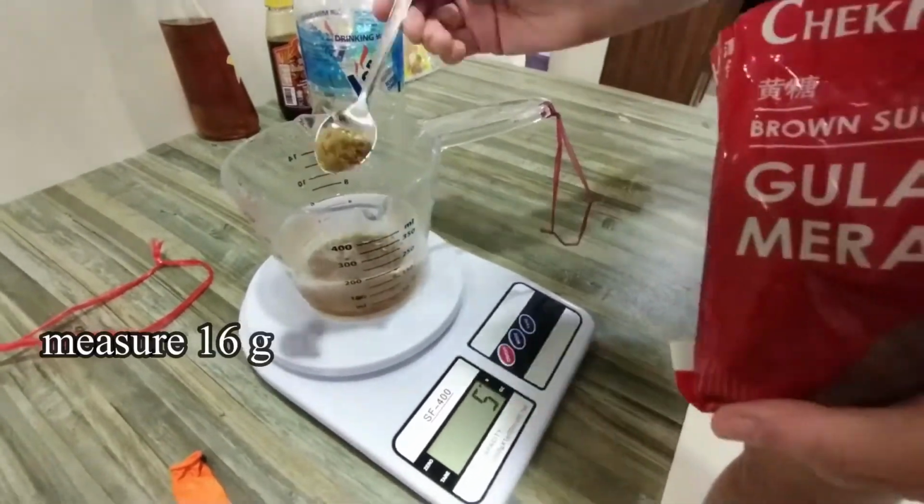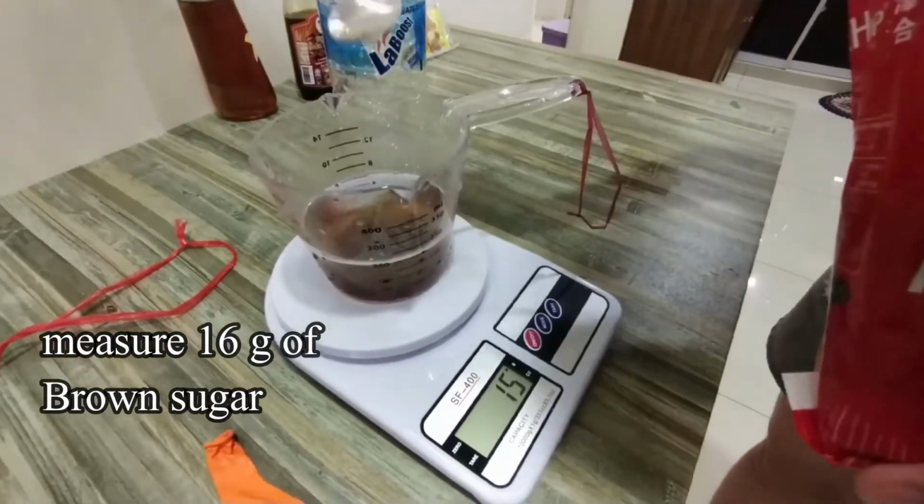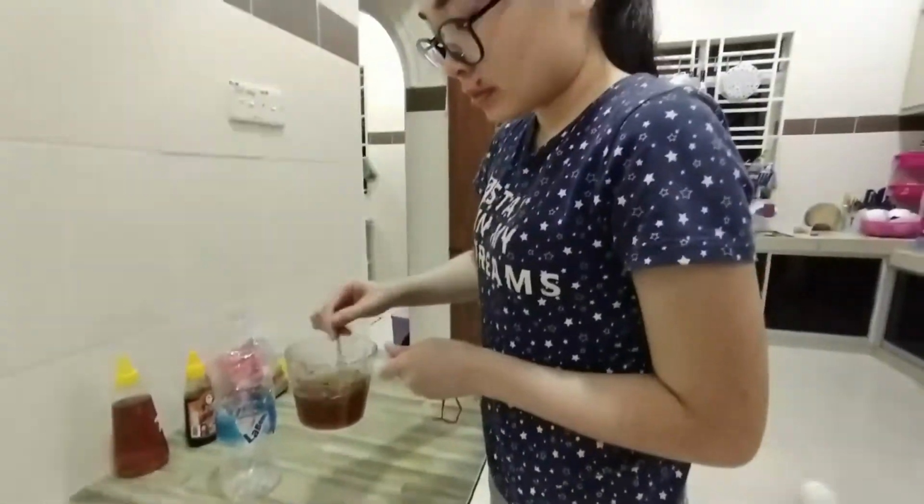After measuring 200 ml of water, then place it on the electronic balance and make it to 0, and then from there we can measure 16 grams of sugar.